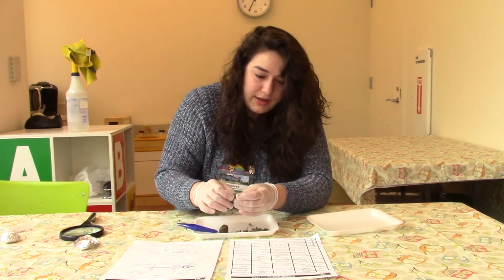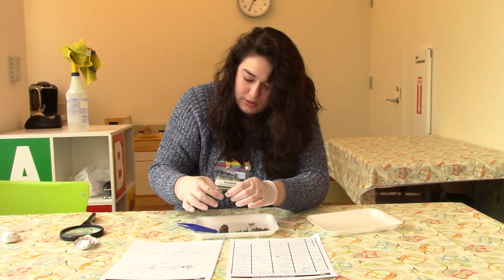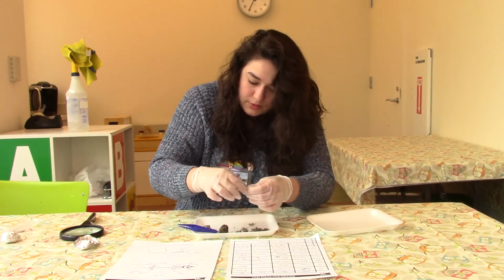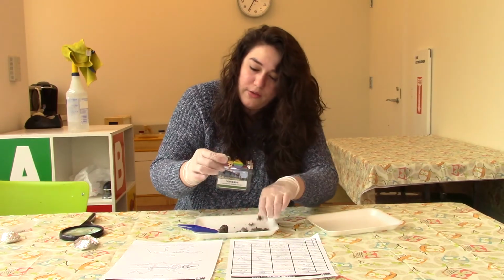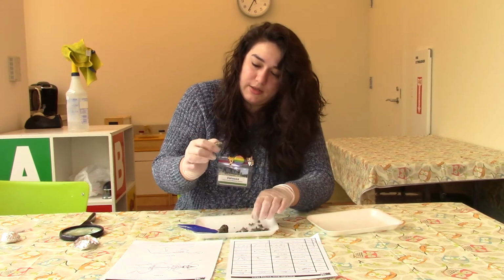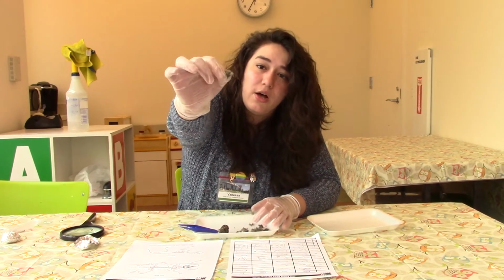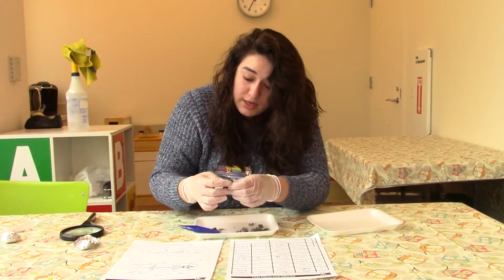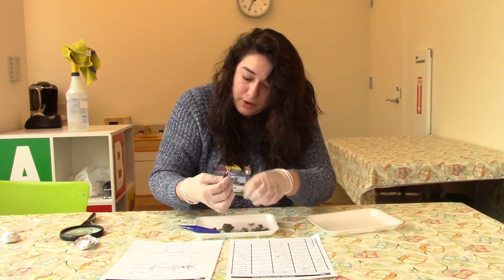Okay, I think I can identify something on here already. But here, let's pull this all apart. I'm going to try to take off all of the fur that's in here so that we can see this a little more easily. But here we have another, this looks like a skull, and it's got 2 teeth on it. And so I'm going to move the camera so that we can have a closer look at this once I've completely taken this apart.